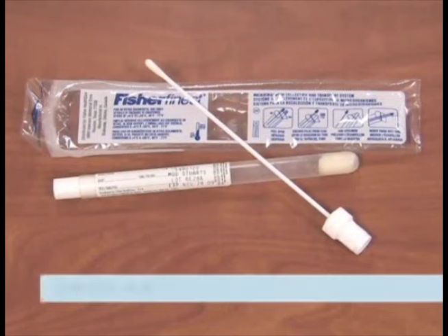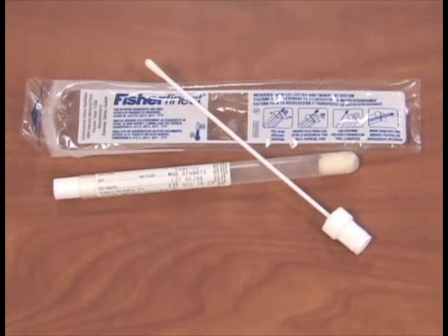A transport swab is a cotton-tipped swab with a protective case and media to preserve the sample during shipment. The swabs can be used for mold screens and viable analysis. Utilize a transport swab in the following manner.